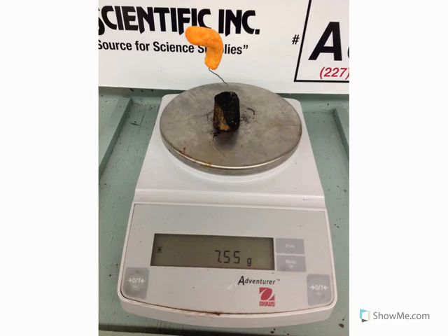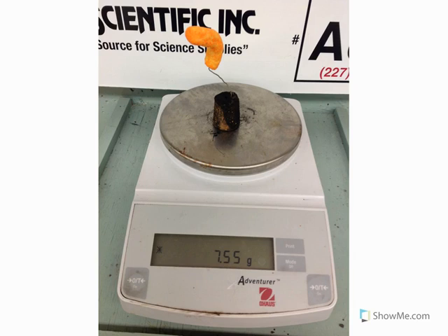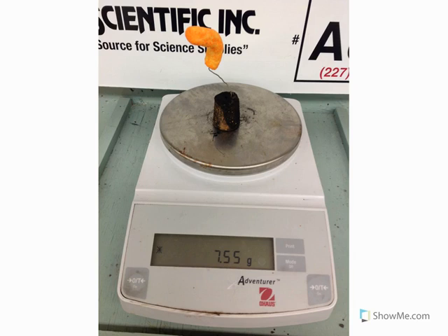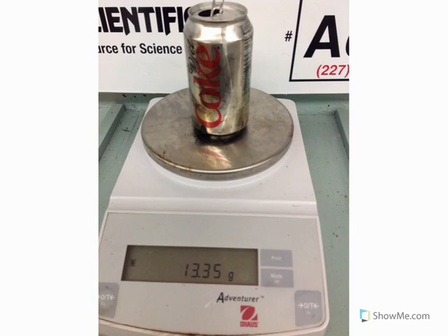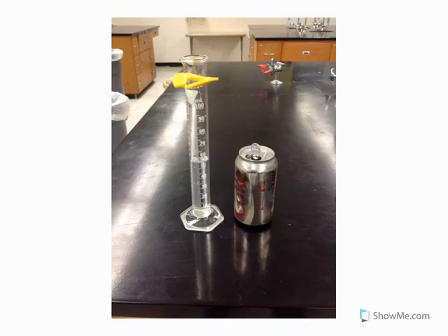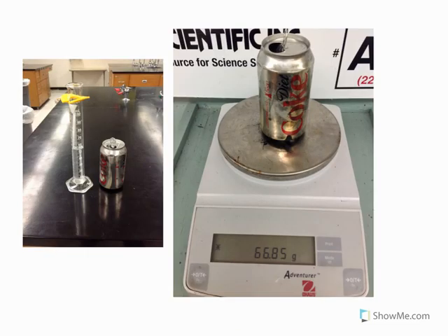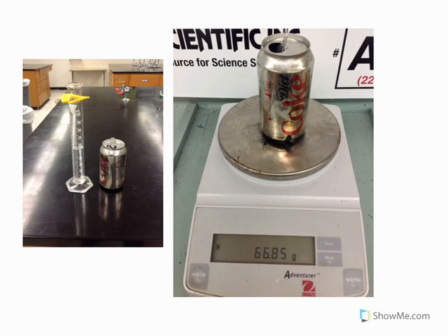Start by placing a Cheeto on a food holder — in our case, a food holder is a cork with a paper clip stuck into it. Measure and record the combined mass of the food holder and the sample. Then measure and record the mass of an empty soda can. Add approximately 50 milliliters of tap water to the can, and then measure and record the mass of the can and the water.